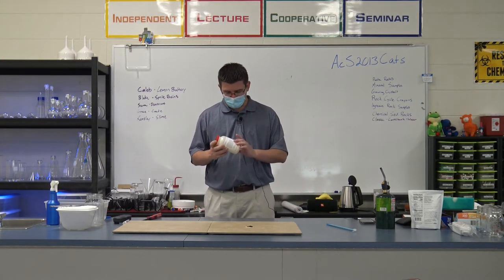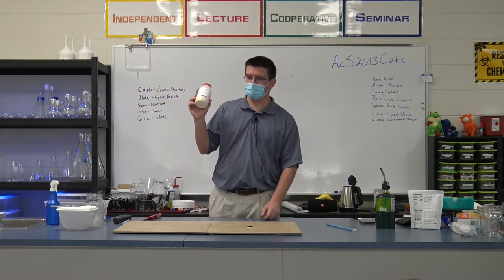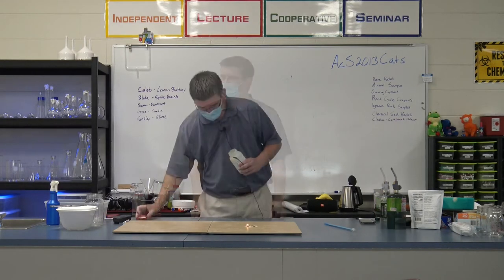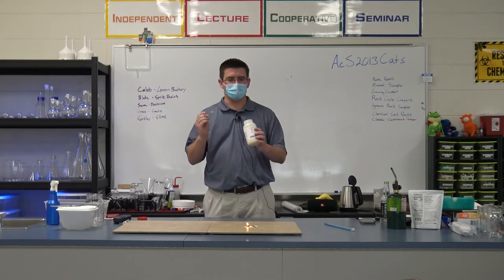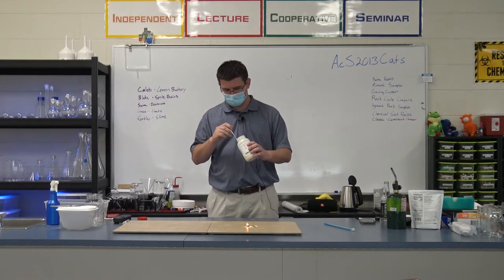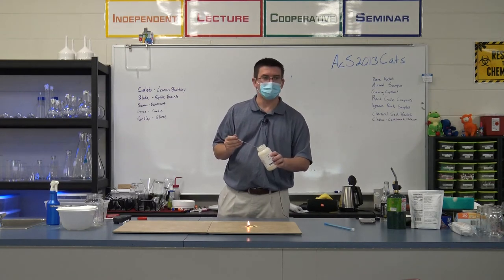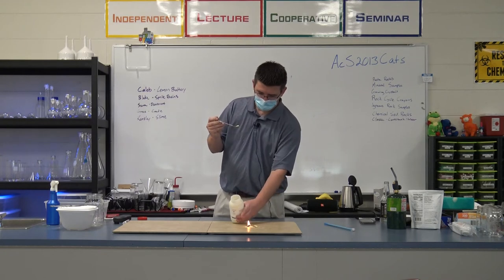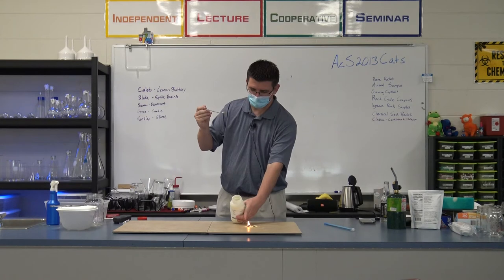But again, we're going to make this interesting. Let me show you why this has a warning label. It's not because of that. It's because of what we're going to do next. All right, so we've got a little bit of Lycopodium burning here. But what I want you to see, I'm just going to take a little bit more Lycopodium. I'm going to sprinkle this very fine powder onto our burning fire. So I want you to watch down here, and let's just see if anything happens. Again, is this the same thing that I have burning right here?